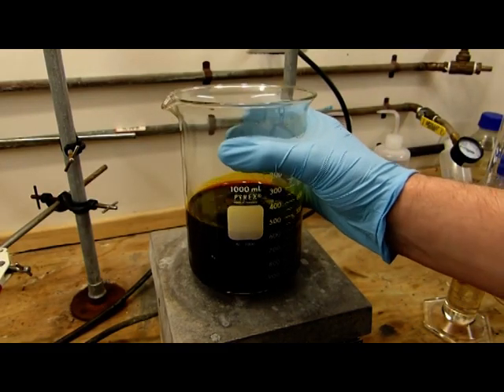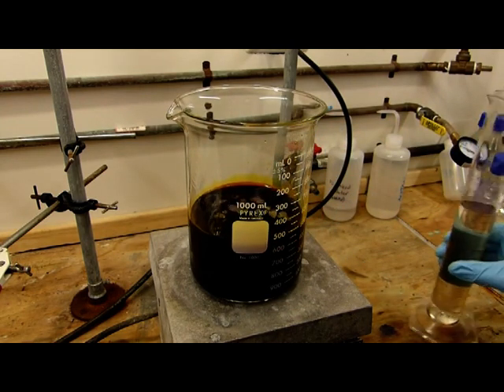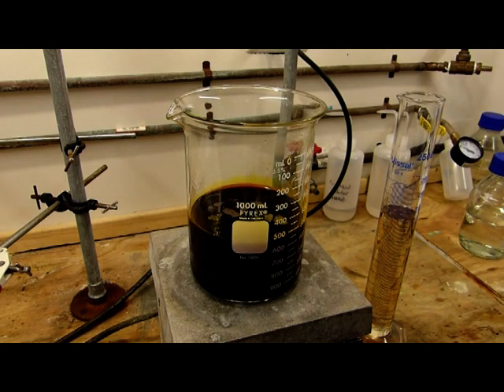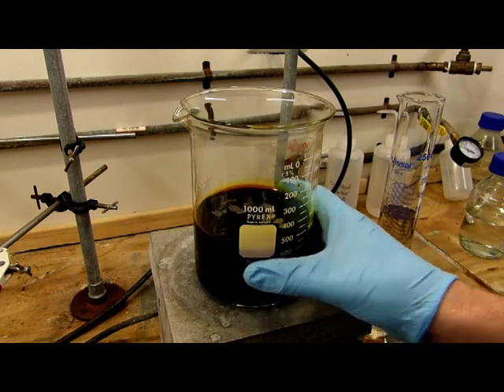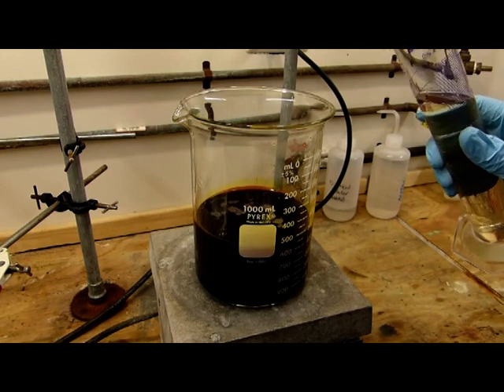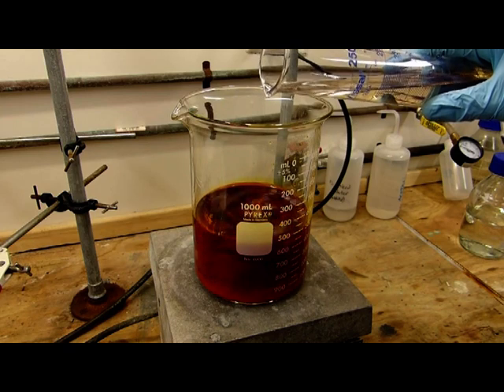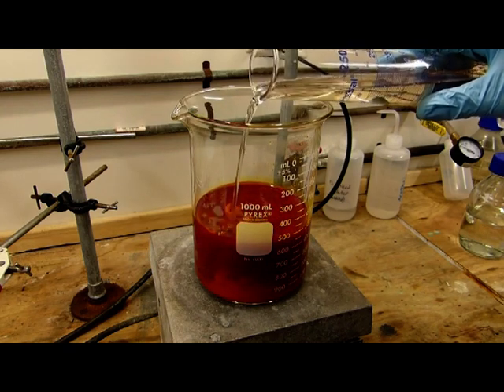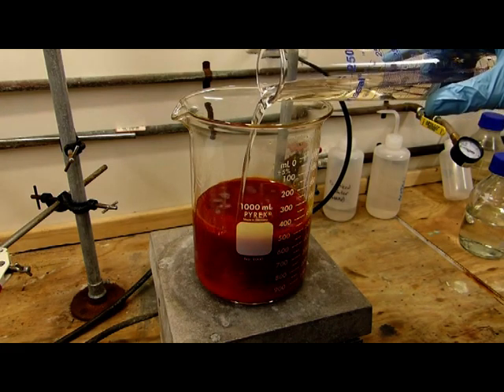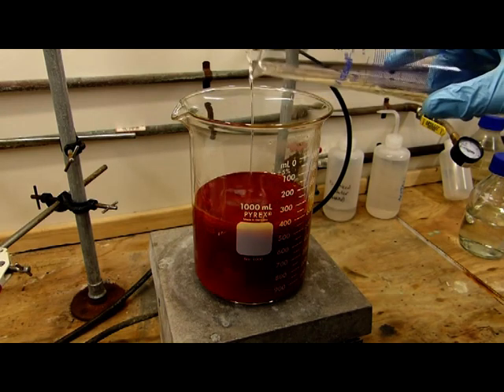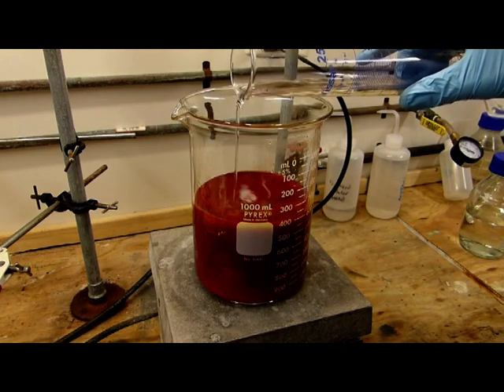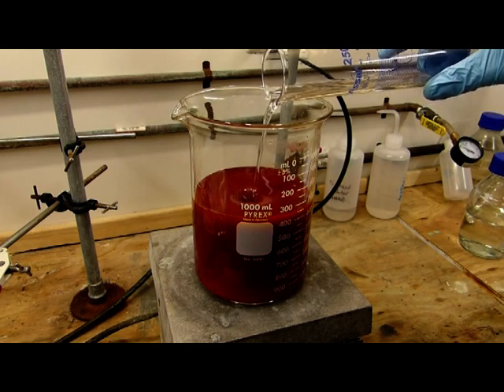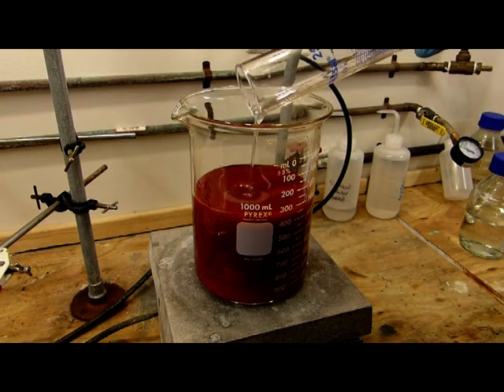This has cooled down quite a bit and we're getting a little bit of chromium trioxide precipitating, but to precipitate the rest we'll add the rest of the sulfuric acid, which includes 200 more milliliters. It's not disadvantageous to add as much sulfuric acid as you possibly can. We could add like three liters if we really wanted to, but to get about 60 or 70 percent yield, about 400 milliliters of sulfuric acid is needed for the 250 of water and the 100 grams of the dichromate dihydrate. In goes the next 200 with stirring, and you can see there that is the chromium trioxide precipitating out.